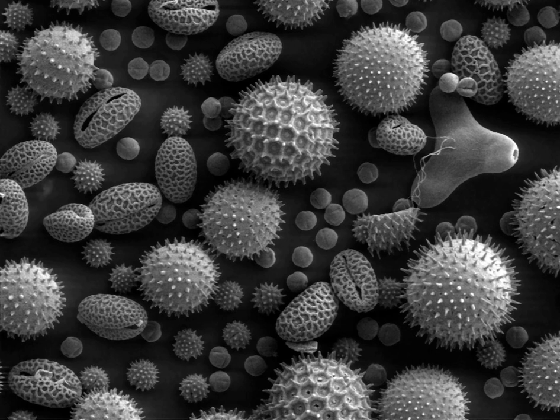SEM is not a camera and the detector is not continuously image-forming like a CCD array or film. Unlike in an optical system, the resolution is not limited by the diffraction limit, fineness of lenses or mirrors, or detector array resolution. The focusing optics can be large and coarse, and the SE detector is fist-sized and simply detects current. Instead, the spatial resolution of the SEM depends on the size of the electron spot, which in turn depends on both the wavelength of the electrons and the electron optical system that produces the scanning beam. The resolution is also limited by the size of the interaction volume — the volume of specimen material that interacts with the electron beam.